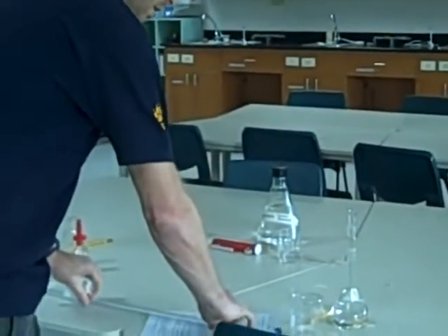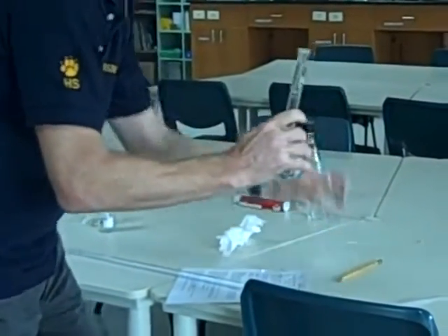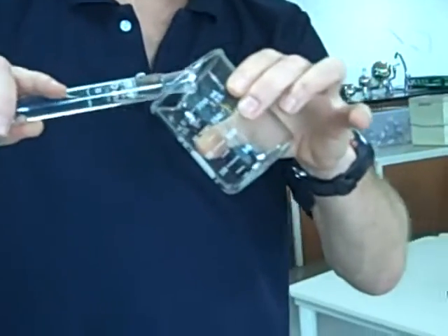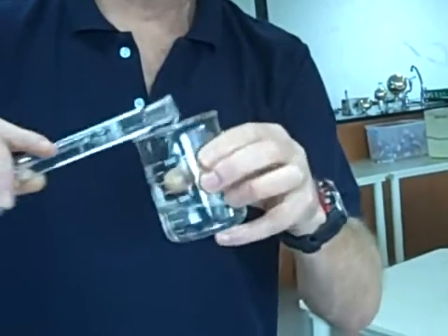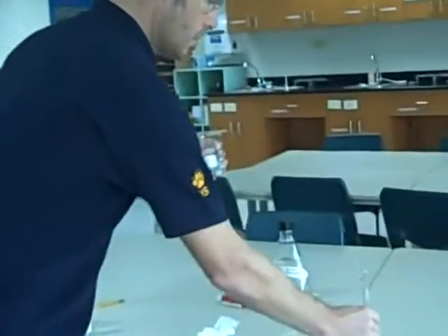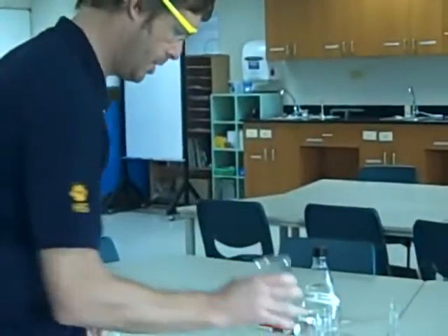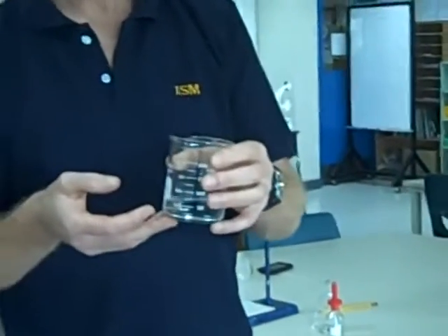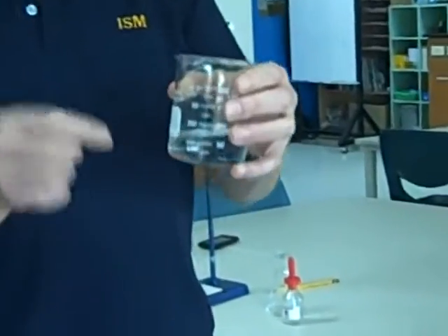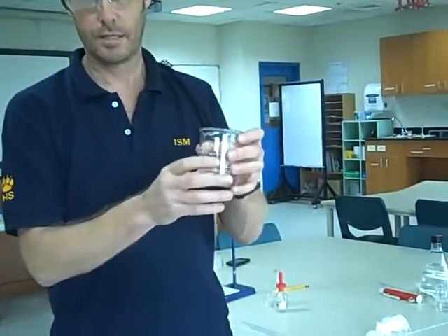And then I'm going to rinse it with a bit of my acid solution. Here's my acid solution — I've got another beaker, carefully labelled 'acid'. This beaker needs to be clean and dry because we don't want too much water in there to change its concentration. Or you could have washed it with tap water and distilled water and then added a little bit of the acid to rinse out any distilled water and then added your acid.